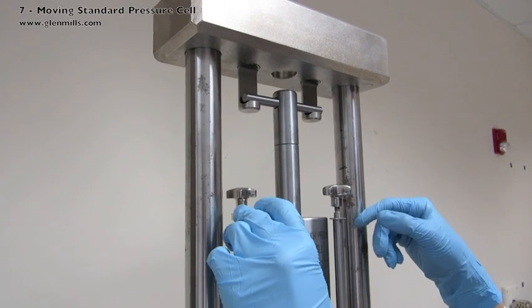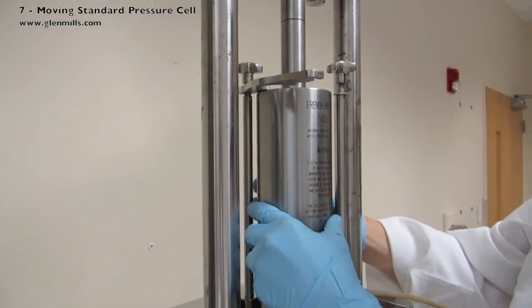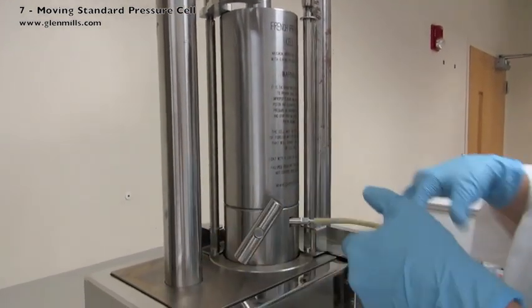Be careful not to bang your fingers or other items. Rotate so that the sample outlet tube faces the front in the direction of the collecting beaker.